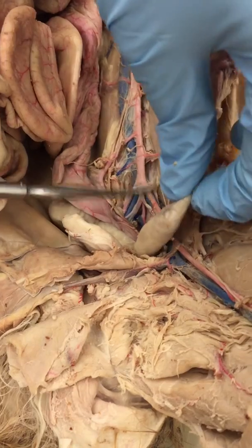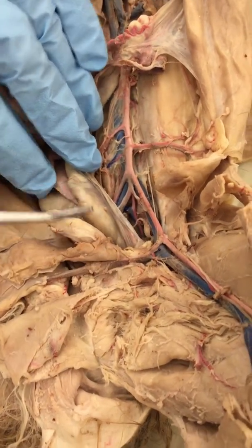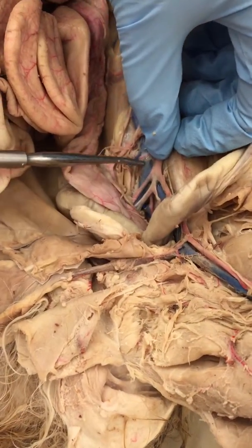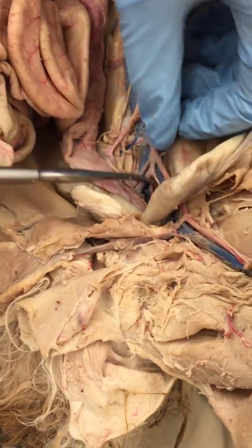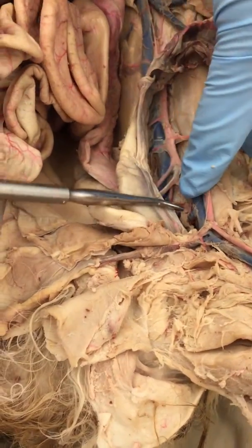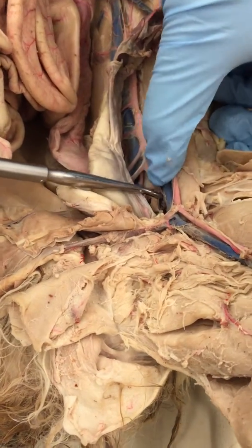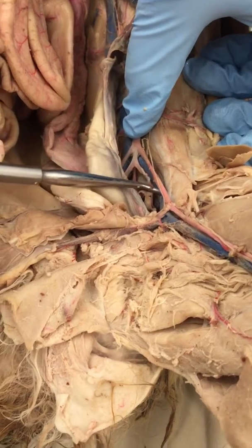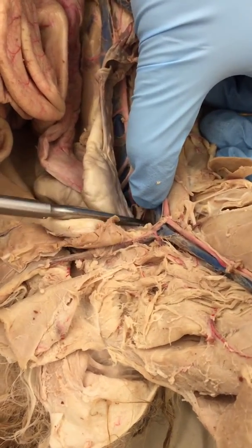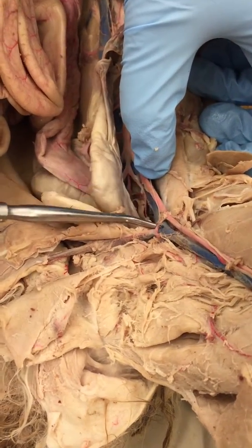And your external is only going to last from here to about here, because it branches off into a deep femoral artery. But we'll go back to the veins. The inferior vena cava branches off also, and it's called the common iliac vein, up until it goes deeper, and this branching occurs. So it's only common from here to here, because when it goes deeper, it'll be named your internal iliac vein, and from right here to here will be your external iliac vein.